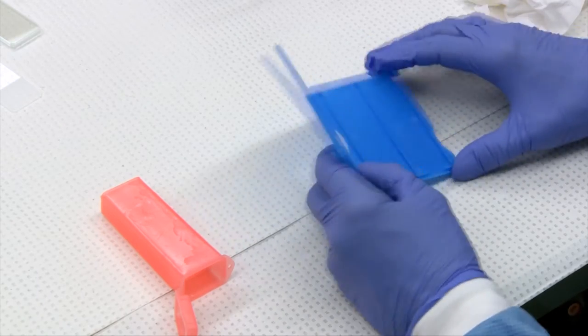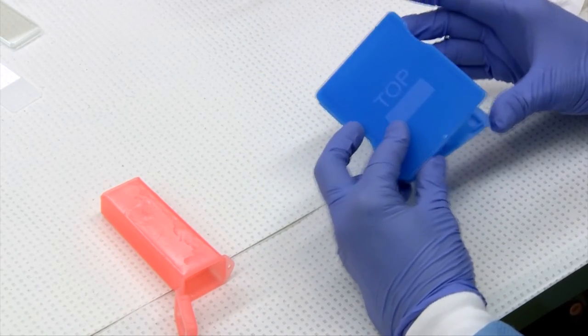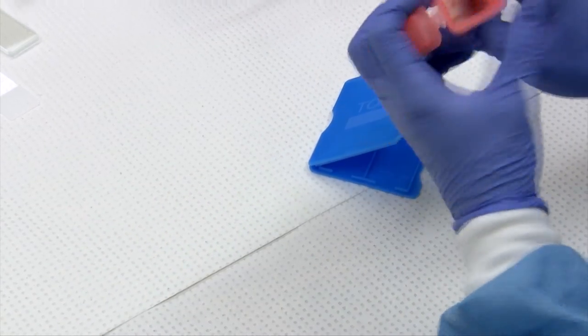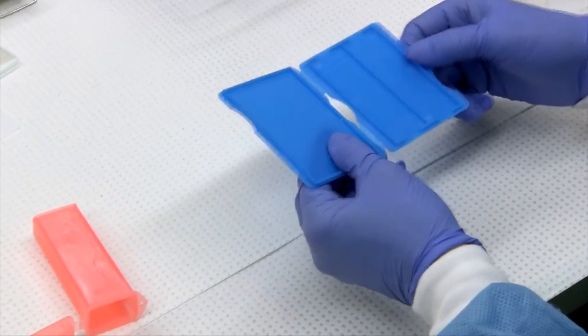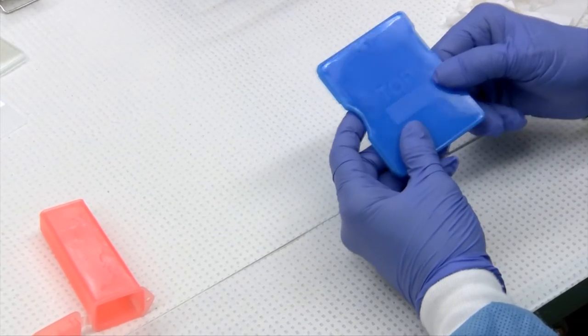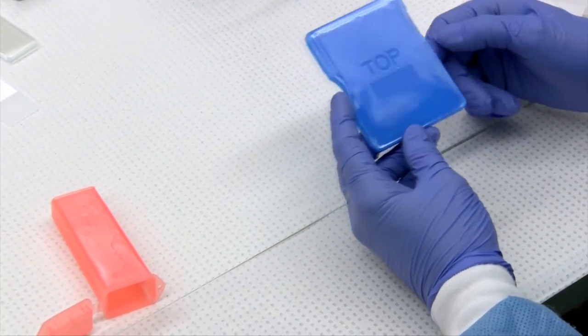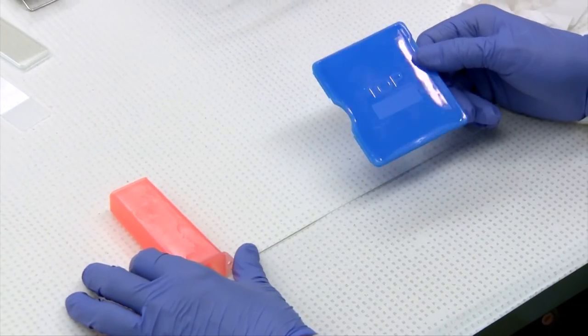So you can get plastic slide protectors. We have them available if you need some and either one works. This one can hold up to four or five slides. This one just holds two. But that said you still need to wrap them in bubble wrap or something like that just to protect them from breakage.